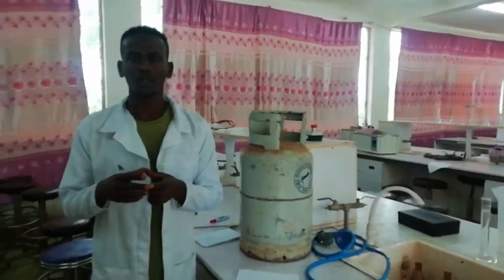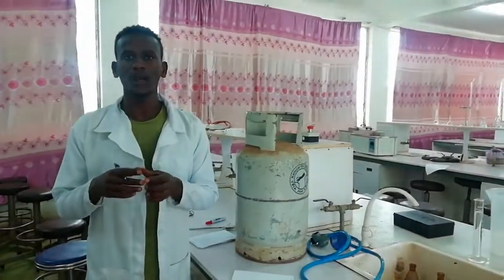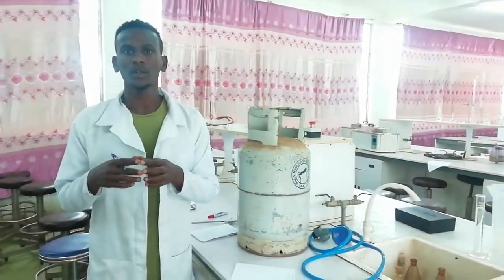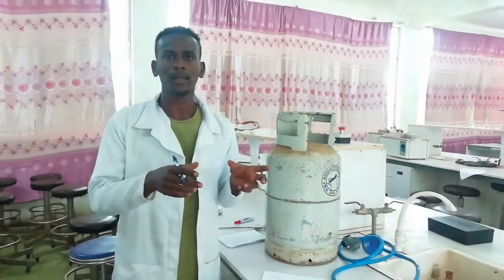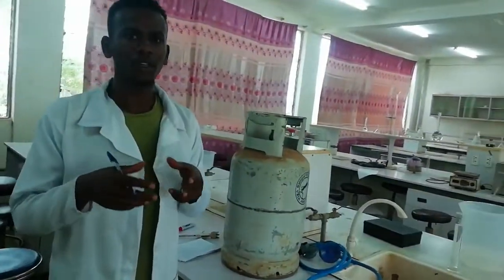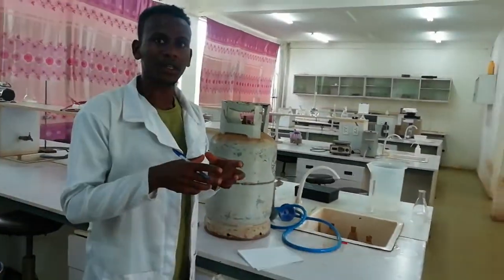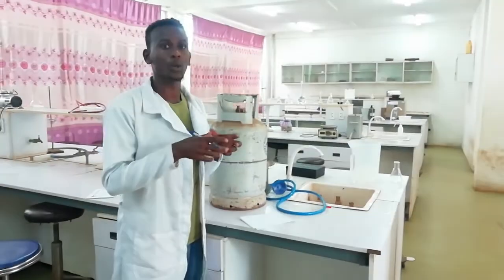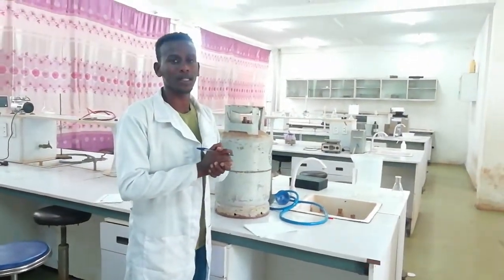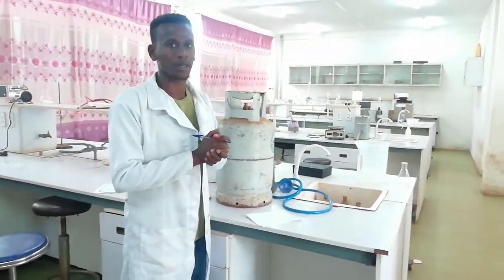In a chemical reaction, we usually have two substances: the reactant and the new product which is going to be formed. In this video, I will show you about combination reaction and also the working principle of the Bunsen burner.